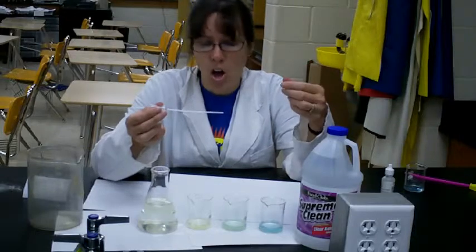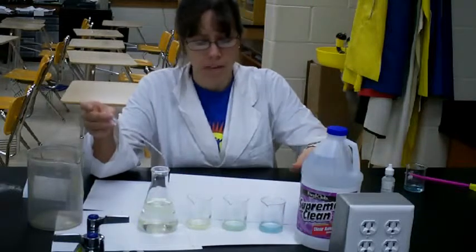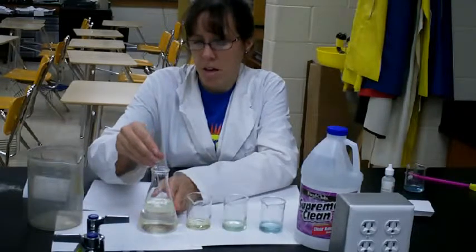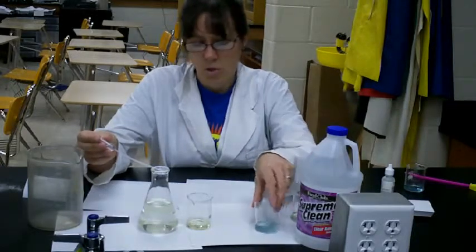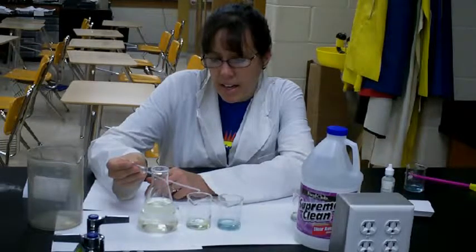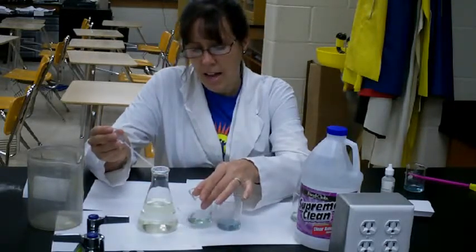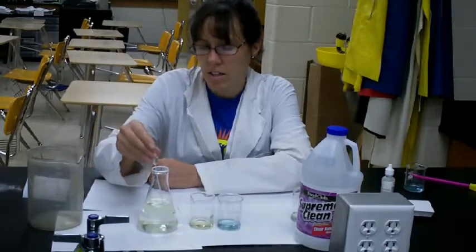So when we get going here, all we have to do is just take some of our sample, and I'm going to remove this so that I can see what's going on here. And you're going to take some of your sample. You want your control right next to your sample, and you're slowly going to drop and count how many drops it takes to turn. And at first I'm going to go 10 drops, and then I'm going to give it a little swirl and take a look, and as I can see that went back to its same color.